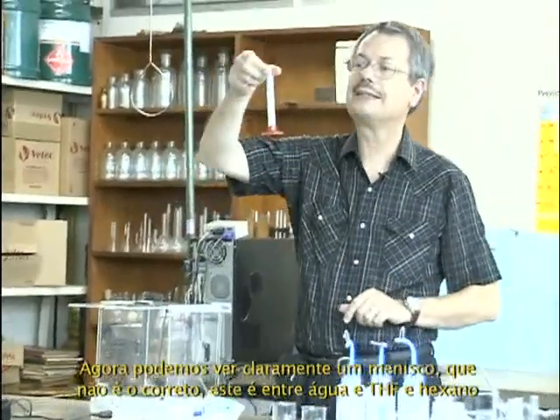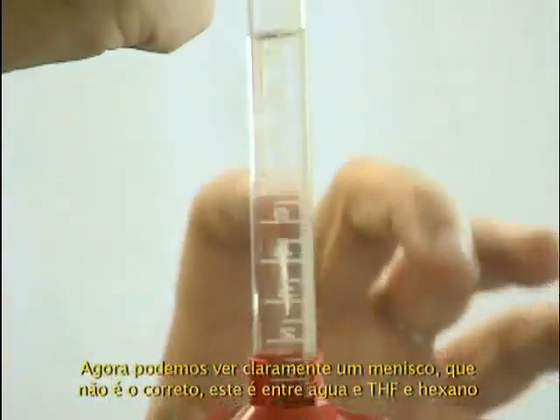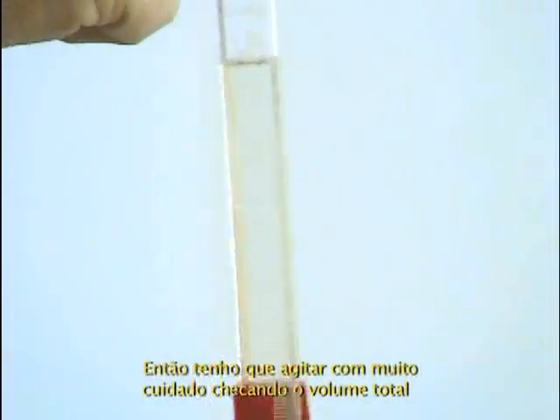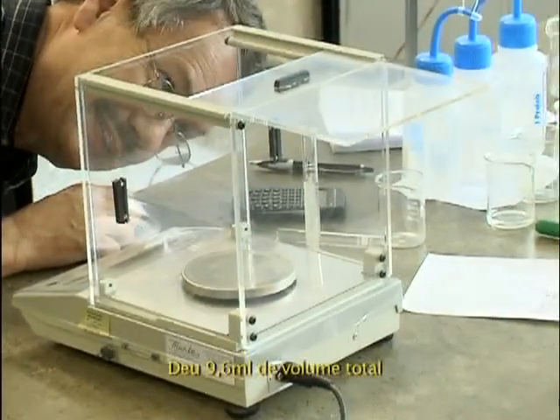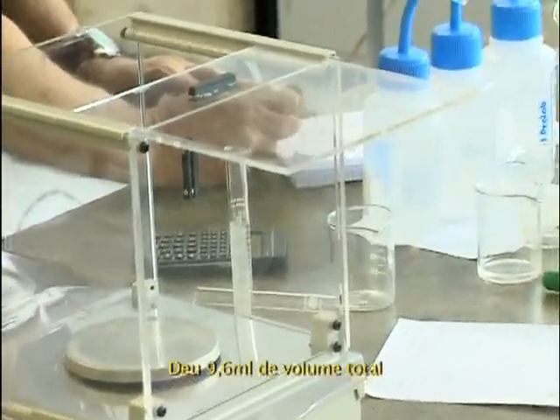Now you can see a clear meniscus. That's not the right one. This is between water and THF and hexane. So I have to shake it very carefully, checking the total volume in that, how do you call this, cylinder? I have to put it on the table. It's 9.6 milliliters total.